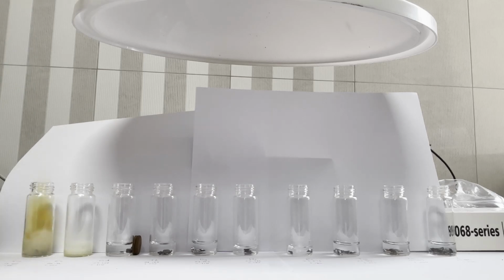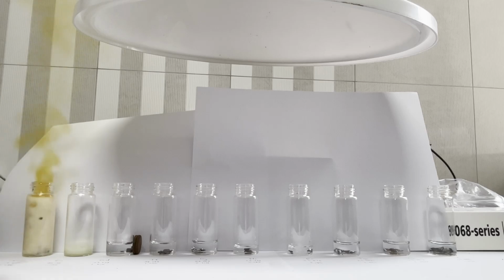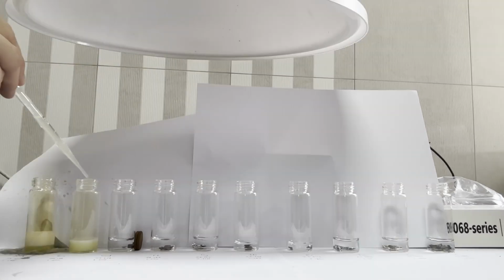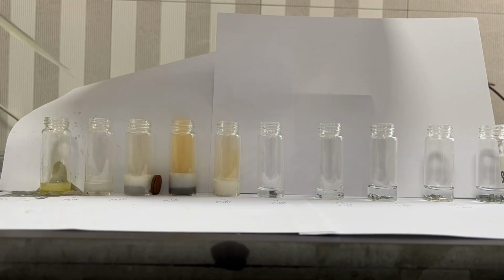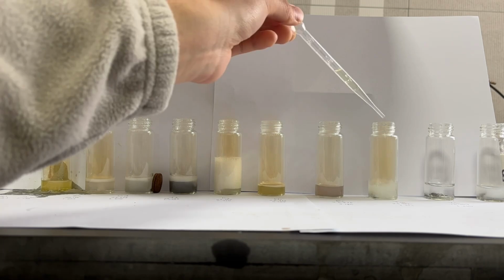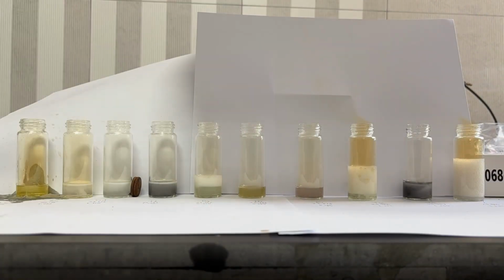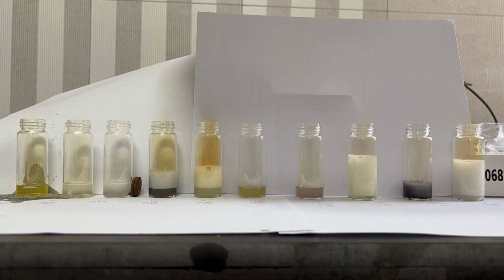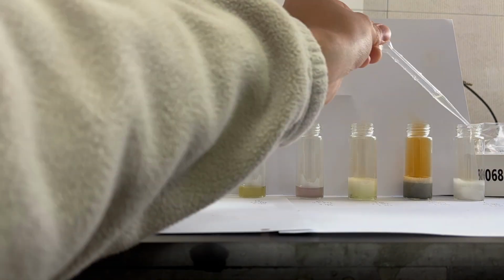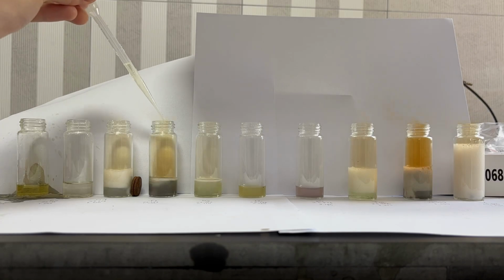I made a big mistake by directly adding 2 ml of acid into the samarium vial, and the reaction got a little bit too vigorous. But samarium is the cheapest of these lanthanides, so I really don't care. As you can see from the vigorous reaction and the evolving nitrogen dioxide, the europium didn't completely react with water. The dissolution of the other rare earth metals proceeded similarly, evolving nitrogen oxides and giving clear solutions. When the metals don't seem to dissolve anymore, I add a few more drops of nitric acid to the vials. It looks like I'm running an underground factory that makes wizard potions of different colors, but I'm really just a home chemist dissolving a bunch of very cool rare earth metals.